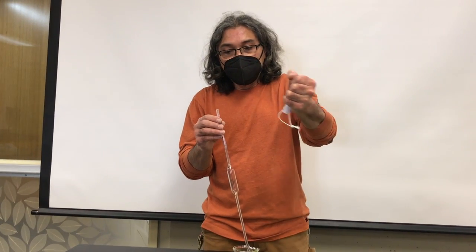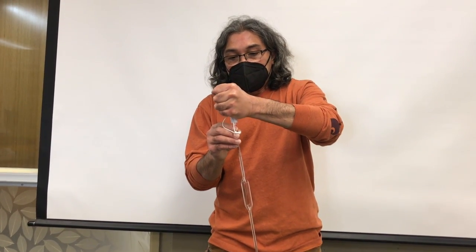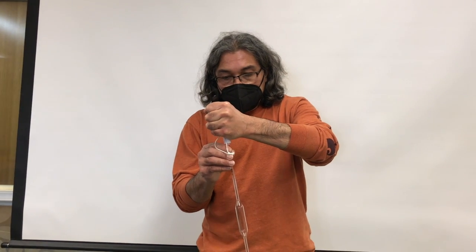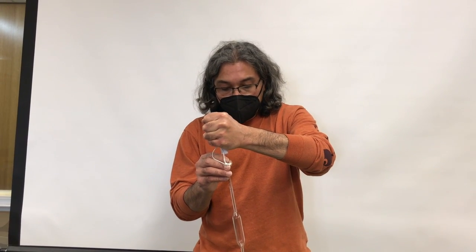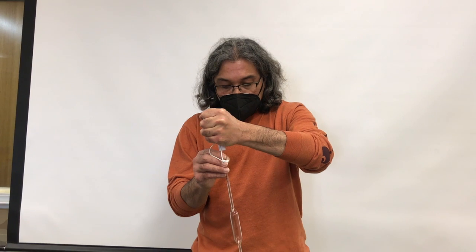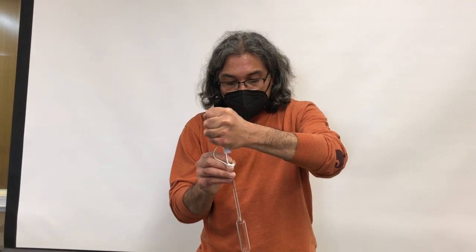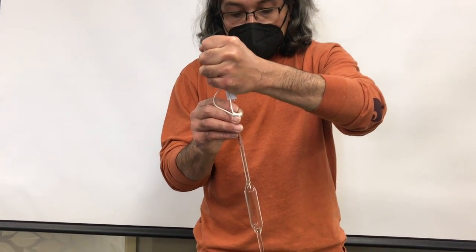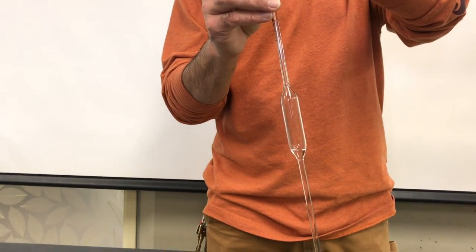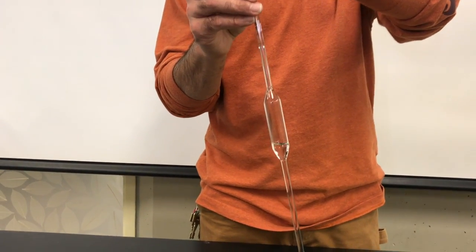Make sure that you squeeze first and then you attach the bulb to the end of the volumetric pipette, and then use the suction from the bulb to start filling the volumetric pipette.